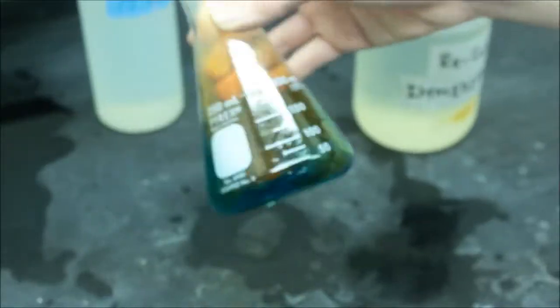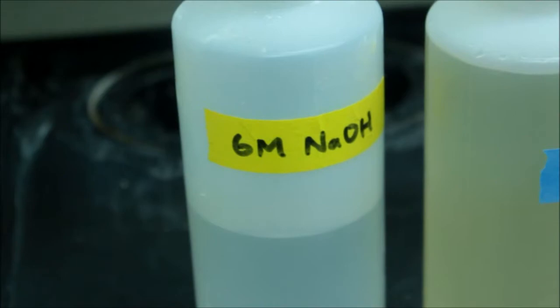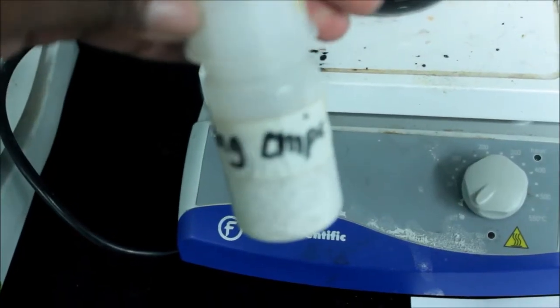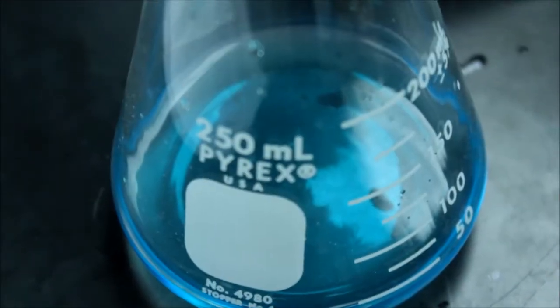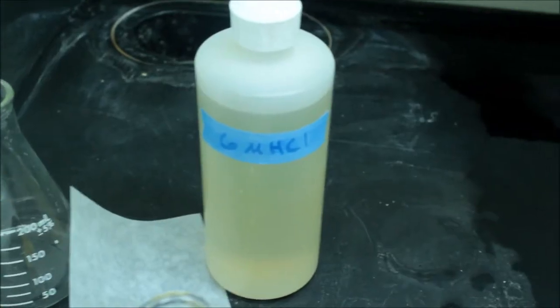Chemicals — and I work with Nitric Acid. Oxidation. Nitration. Blue and green. Precipitation. Put it on a hot plate and get a black precipitate. Then filter it. Sulfuric Acid, distilled water, filter paper. And then I collect the blue solution and then add zinc. The color change is colorless. When you add ammonia and see there is no color change. Then dry it. Collect the weight and calculate. Final over initial times 100% recovery. Copper Cycle.